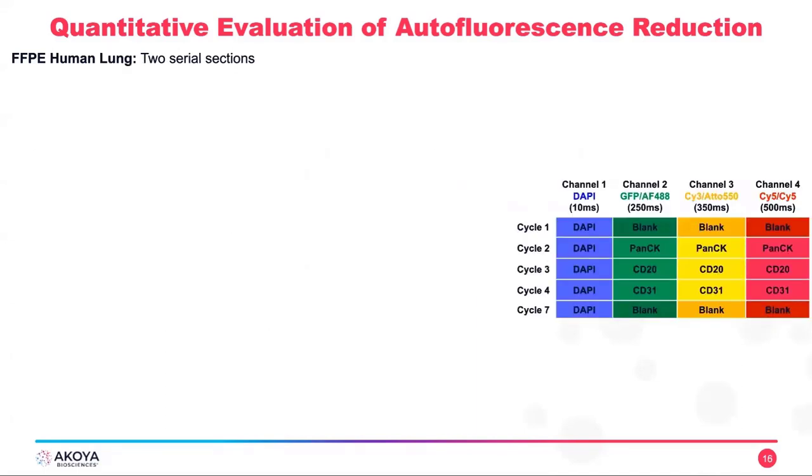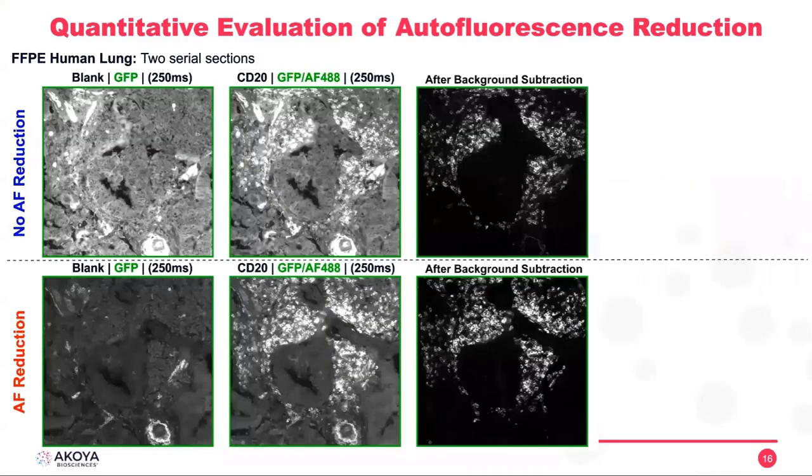So now I'm going to take another example of FFPE human lung tissue, which is also known to have high autofluorescence. But in this example, we have used exactly the same antibody, but in different channels. And I'm going to focus for this presentation on the CD20. So if you look at CD20 in the GFP channel, we can see with no autofluorescence reduction, very, very high background here. All the higher intensities that we are seeing here are the CD20 positive cells.